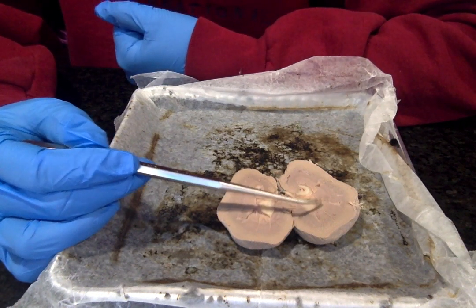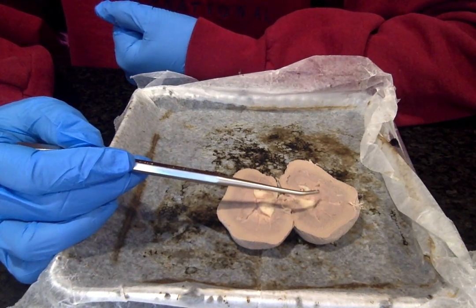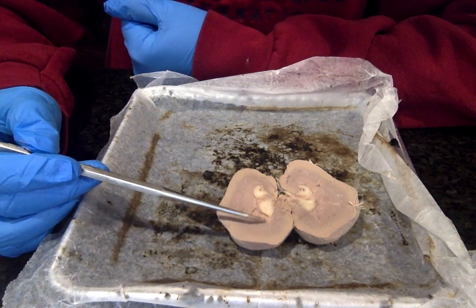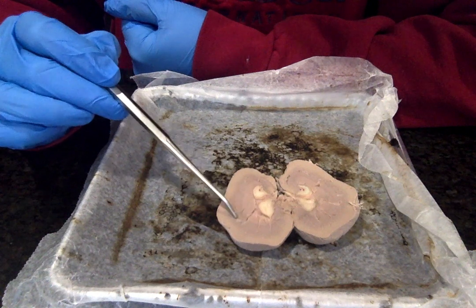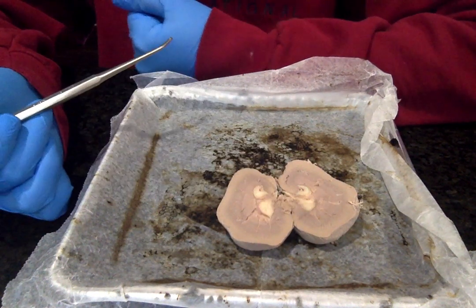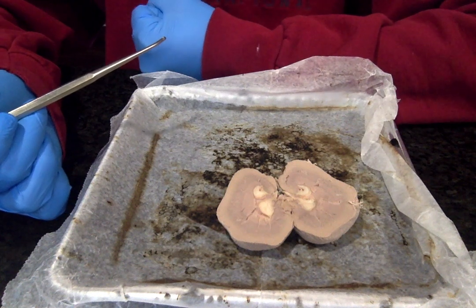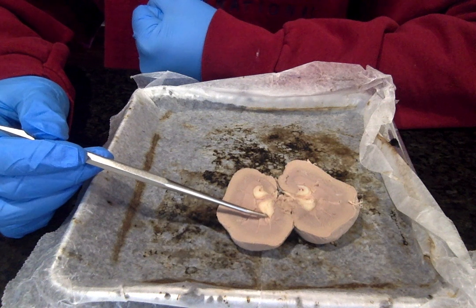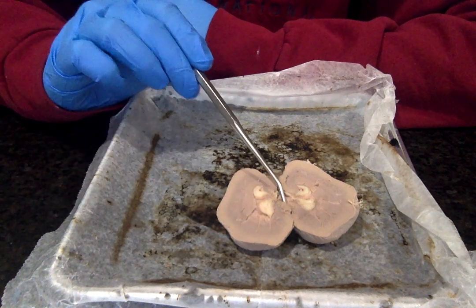Inside the renal medulla, you will find the renal pyramids, which are these structures found between all of these lines here. And the renal pyramids are repeating cone-shaped structures found in the medulla with the base facing the cortex, so the base out here, and the apex facing the hilus, which is down here again.